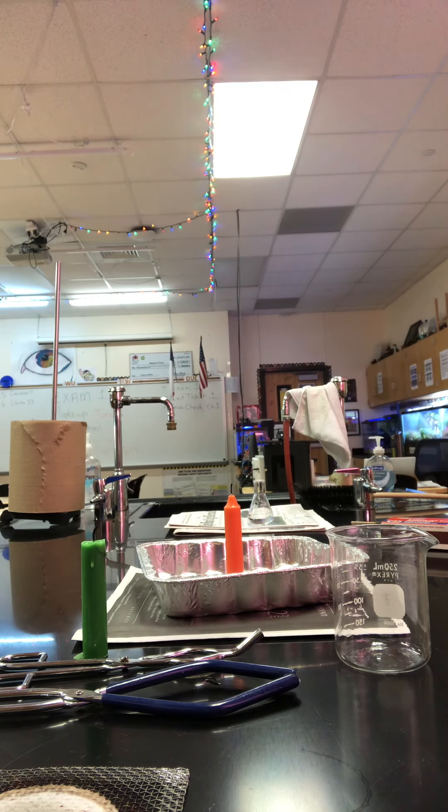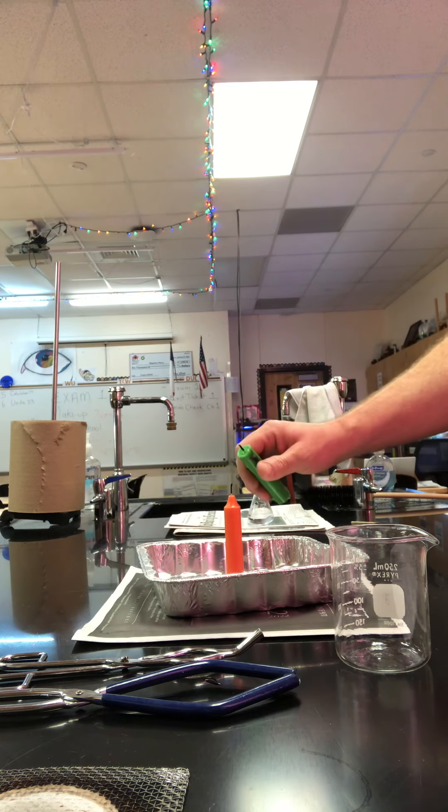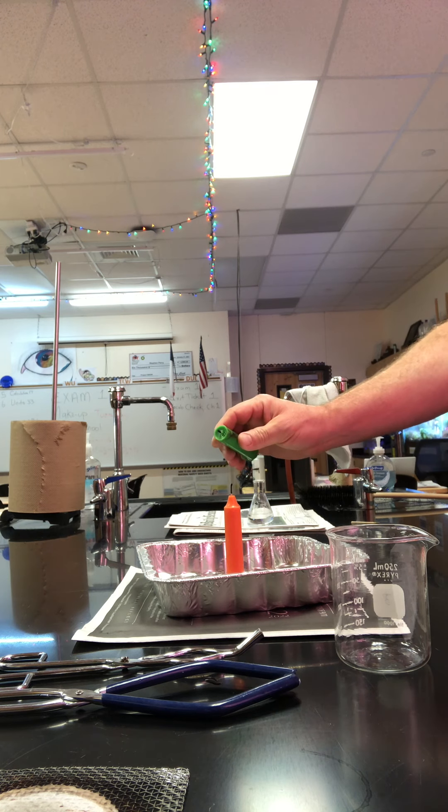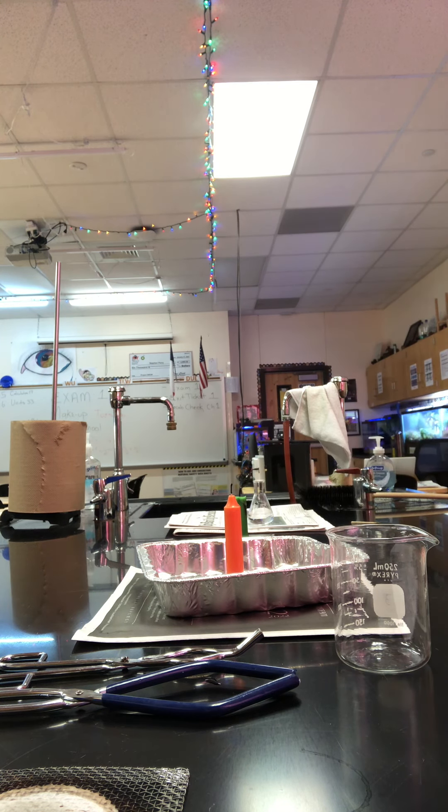So what color do you see? What shape is the flame? Is it orange? Is it red? Is the wax burning? Is the wick burning? So eight things you see. Then we will light a second candle. This one will be burning. We'll light this one, we'll blow this one out and then we'll hold it in the smoke and you'll watch the flame go back down and light the candle. It's actually kind of cool.